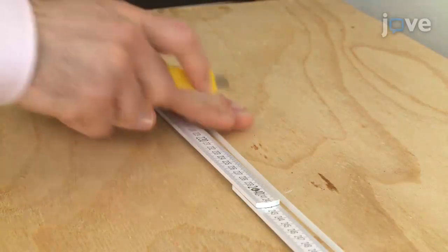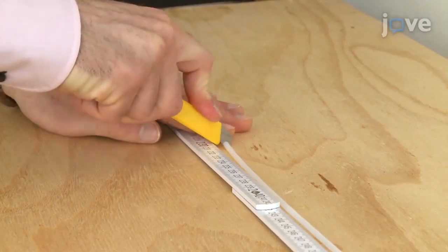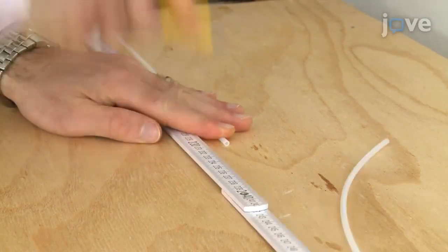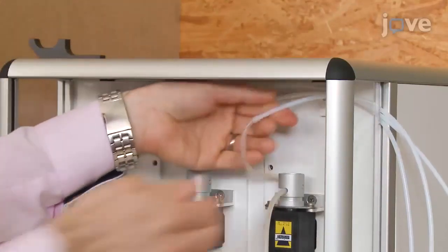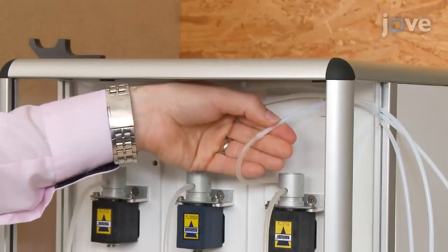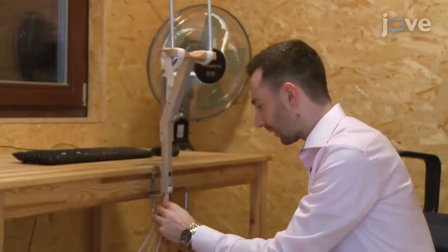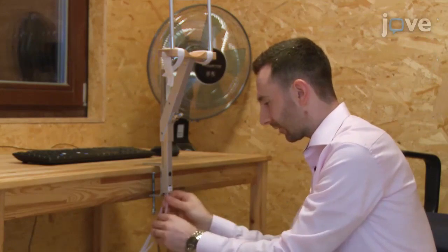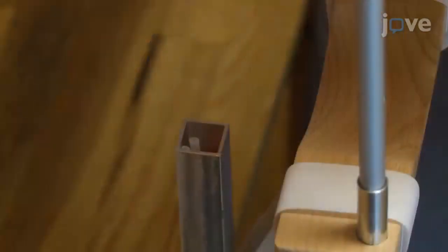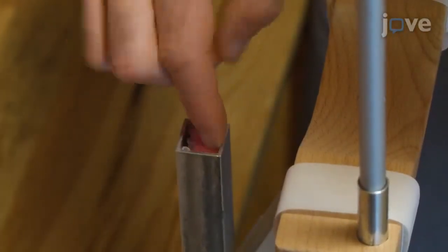To prepare the olfactometer, cut the tubes to the appropriate length and tightly secure them in place. To control for tactile stimulation, present the tubes inside the metal bar that supports the chin rest.